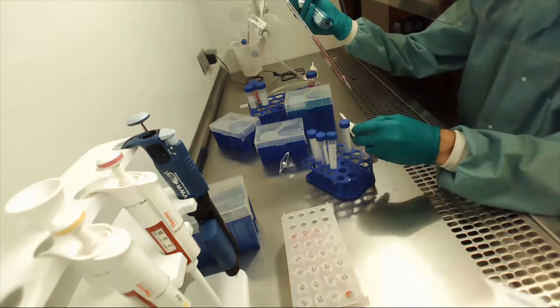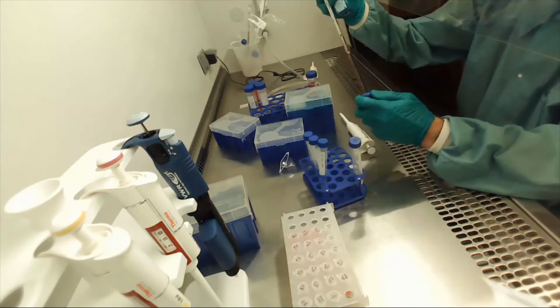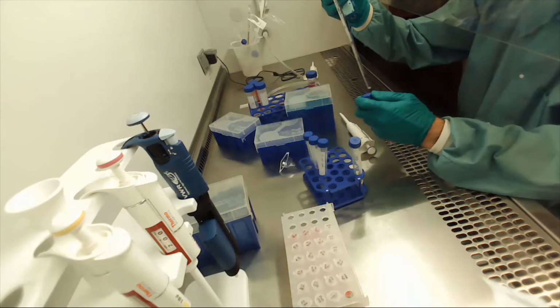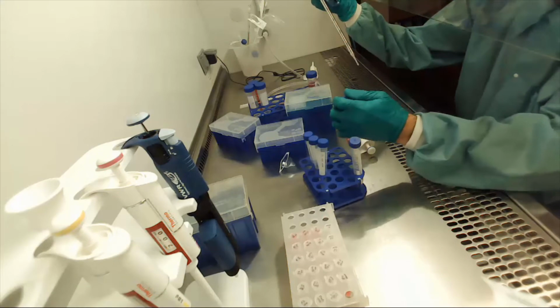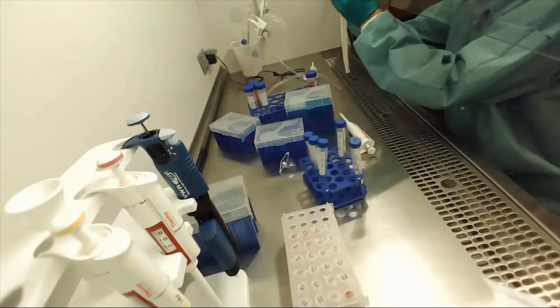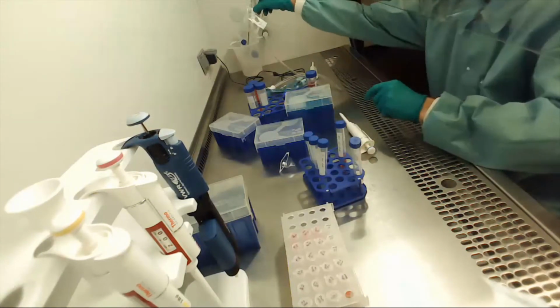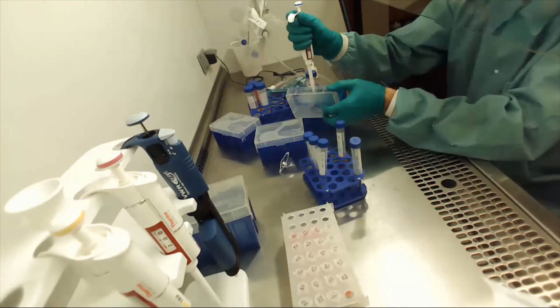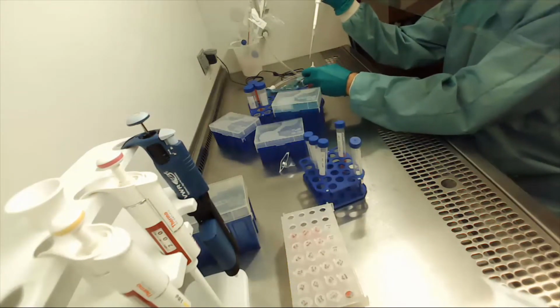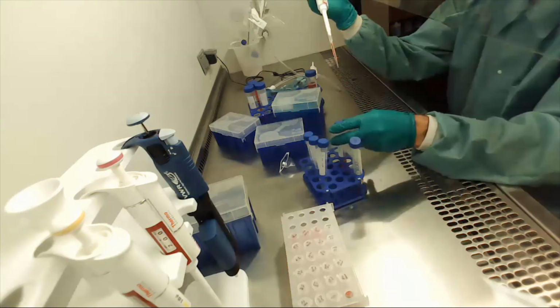Okay, looks like I got 4 pretty good. And now I add 1 of my DMEM that has 4.5 milligrams per mil of glucose.